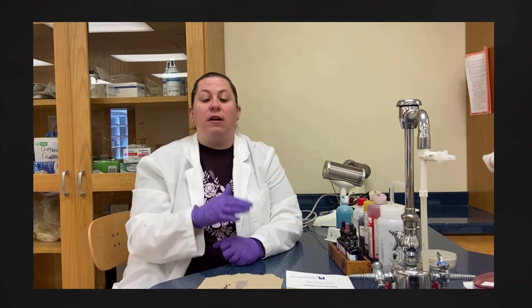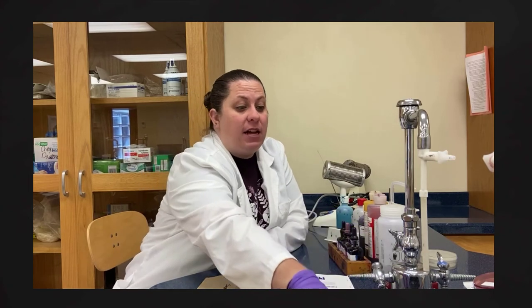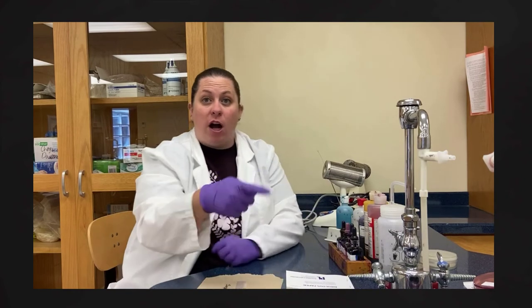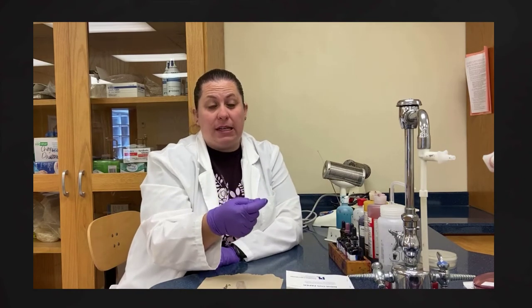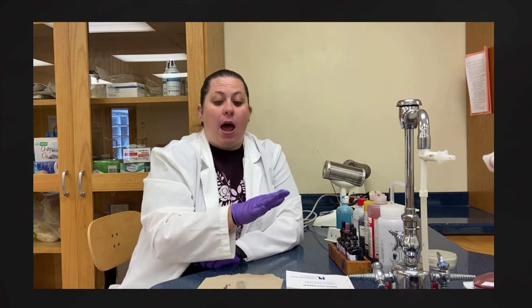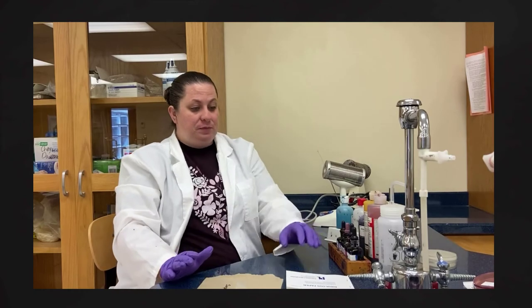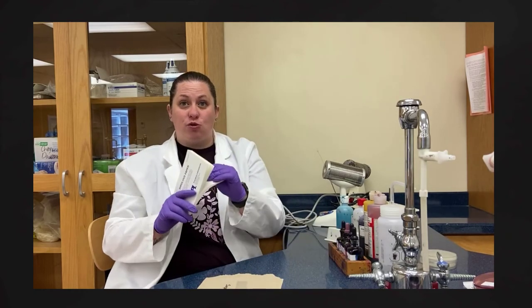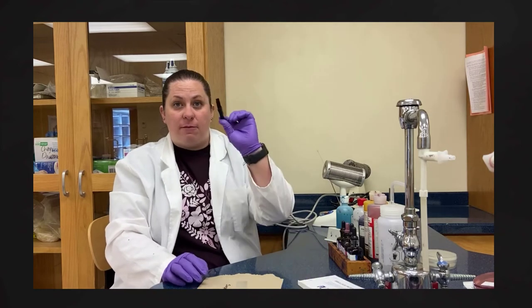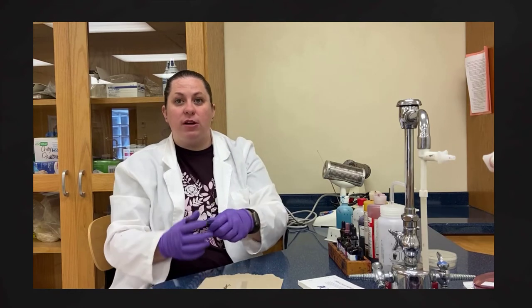I'm going to do a couple of short videos explaining the different staining types. I have my staining station set up here with a staining rack that goes across the sink. I'll let water run continuously as we go through the process and will probably do a voiceover. I also have my slides, bibulous paper for drying the slide after staining, and a clothespin to help transfer slides without getting stain on my hands.